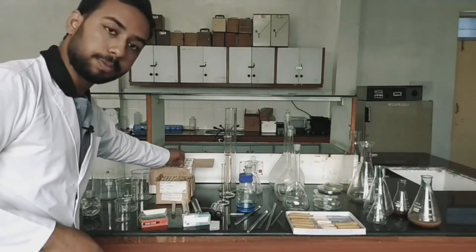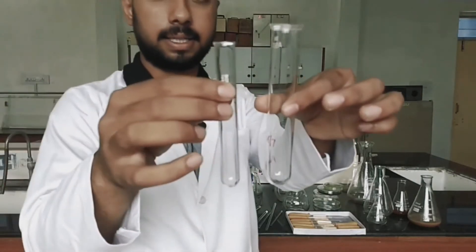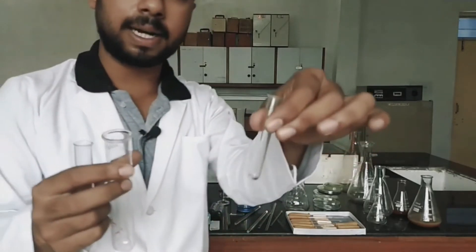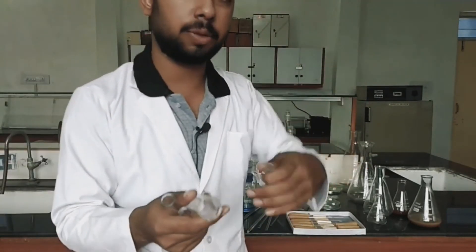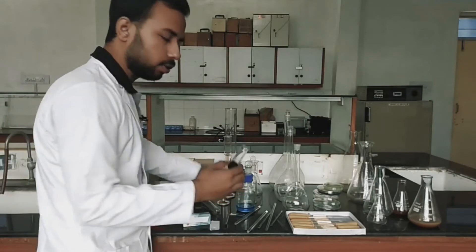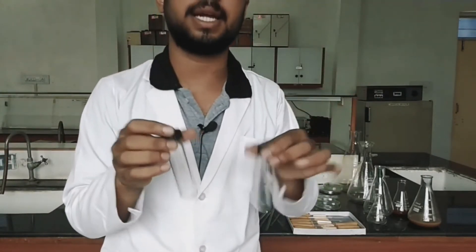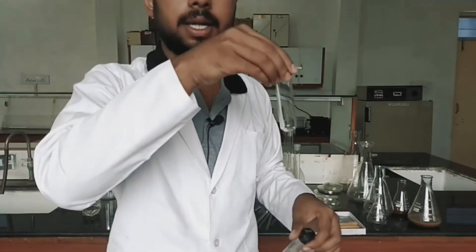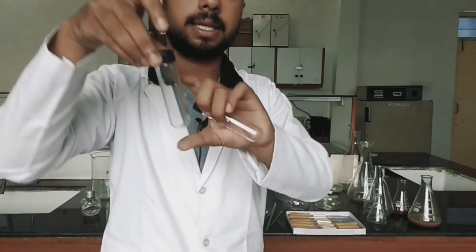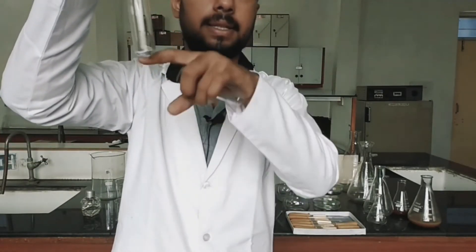Next is the test tubes. There are lots of varieties — a bigger one, a smaller one, and an even smaller one — used according to their purposes. Related to test tubes are also the centrifuge tubes, which are used for centrifugation. When we do centrifugation, they require centrifuge tubes from which the liquid sample is collected so that the supernatant is collected at the top and the pellet at the bottom. These are leakage proof.